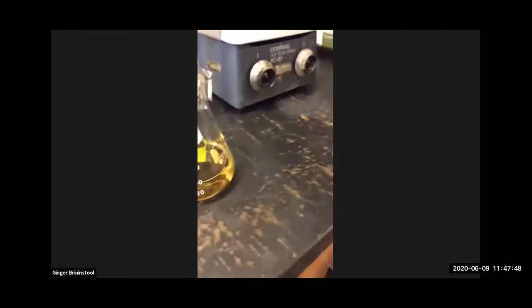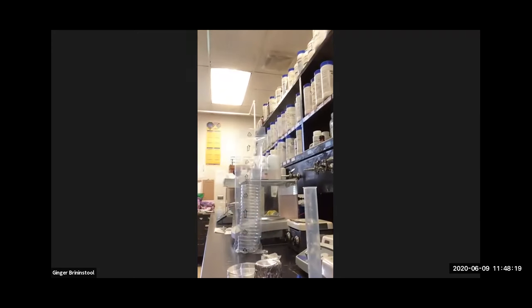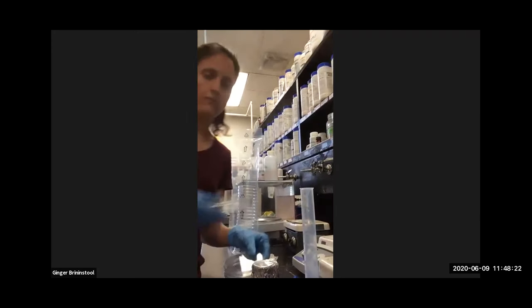And I'm going to grab a sleeve of plates. All right, who wants to take a guess as to how many plates I'm going to get out of that 100 mils? Let's see. All right, so I'm going to grab a stack. Always better to grab too many. That way, you can always stick back in what you don't use. The plates, when I take them out, grab two over here I didn't use earlier.